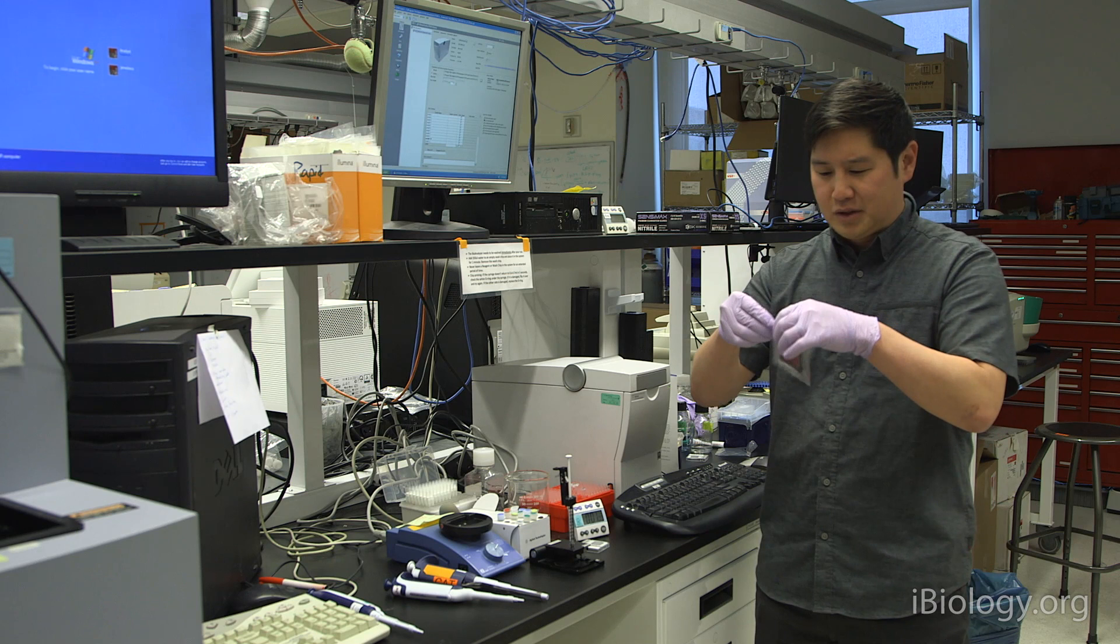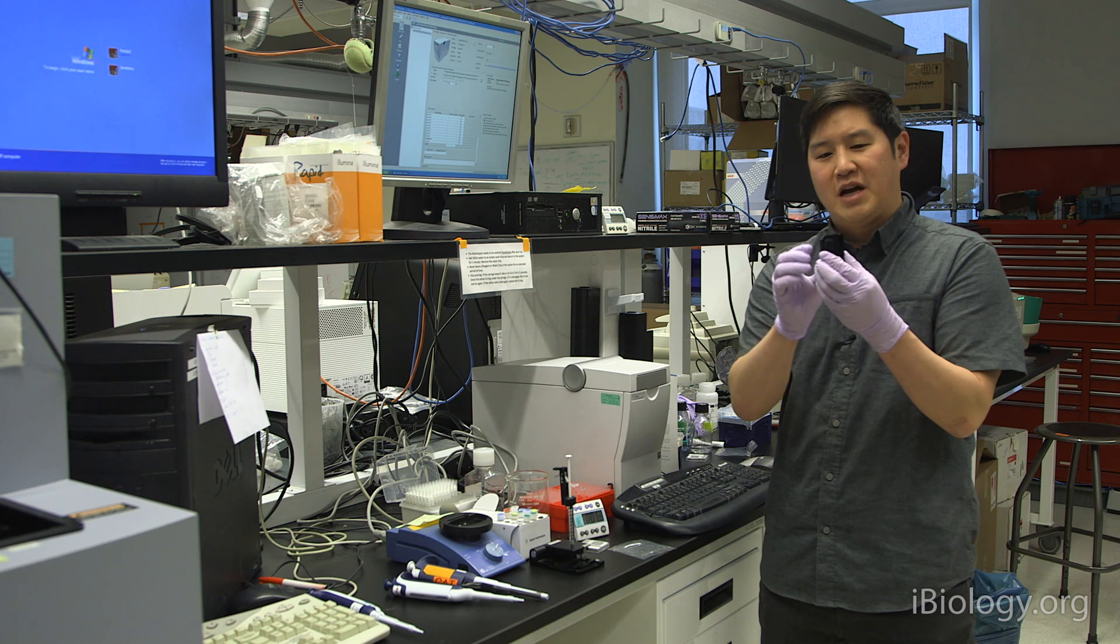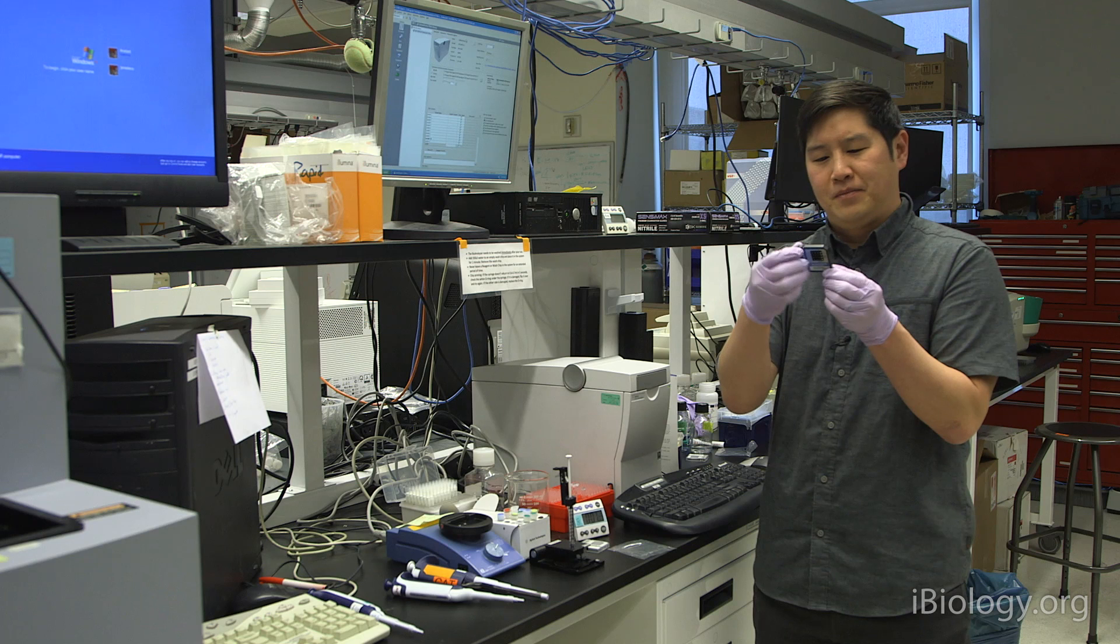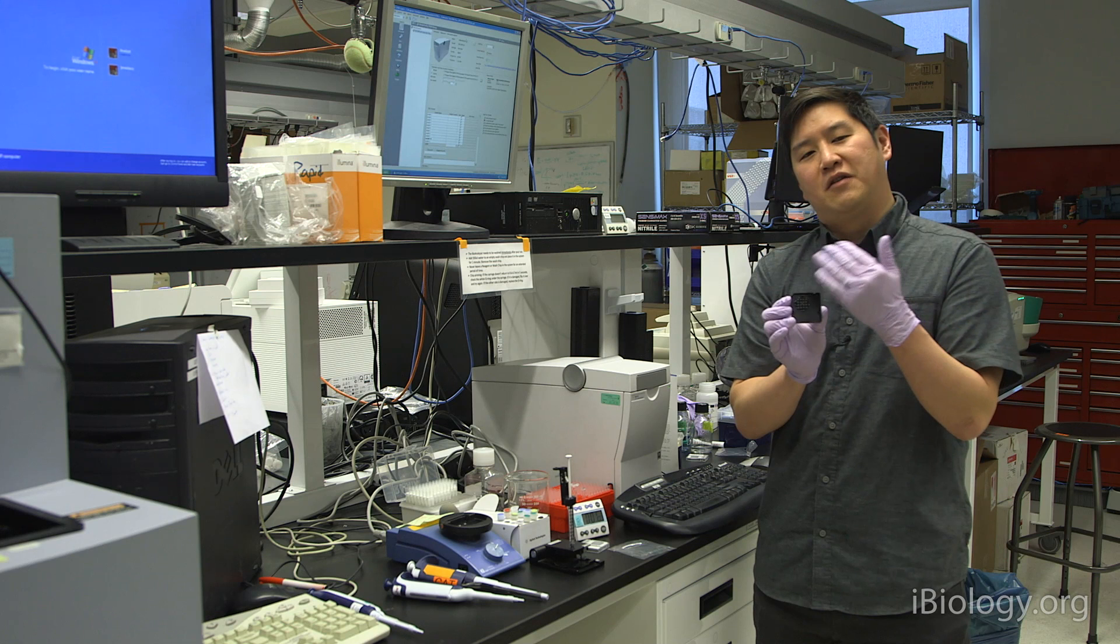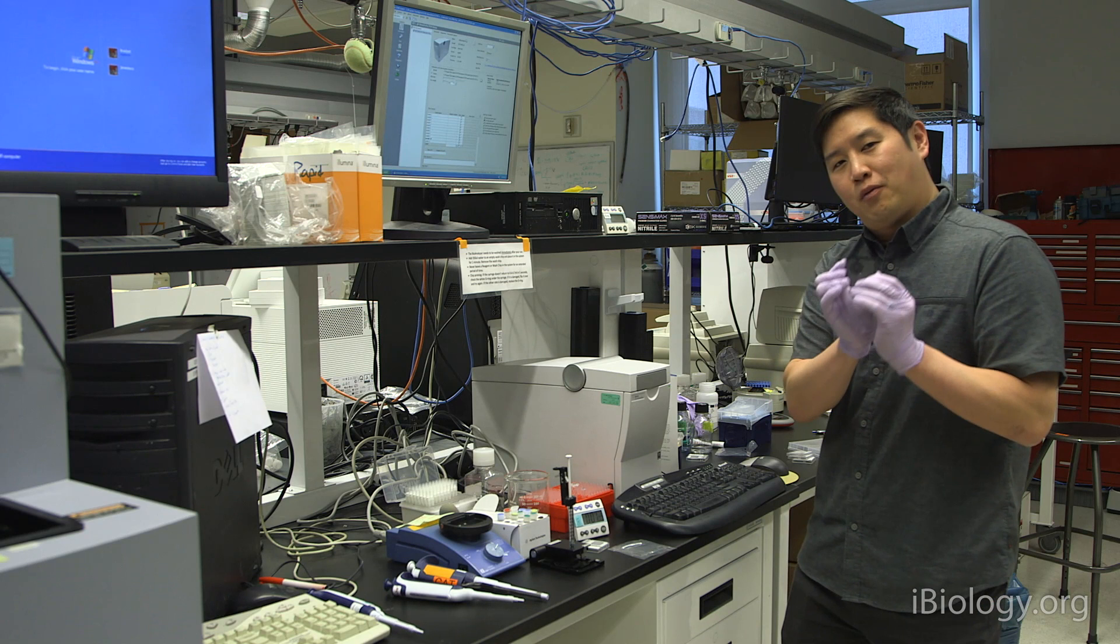I'm going to open up this chip and show you some more details. The chip is actually made out of glass, and there are several wells on the chip. This glass chip is embedded into a plastic frame. On the back of this chip, you'll be able to see a whole bunch of different channels, and this is where all the different samples will run and get separated and then get detected.